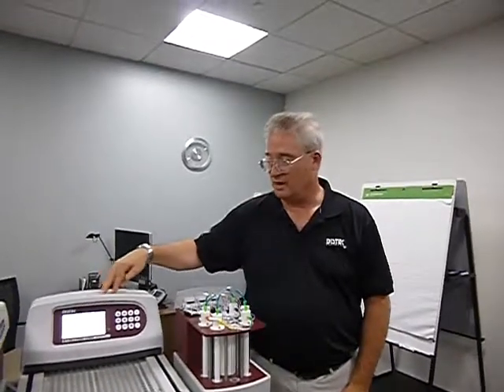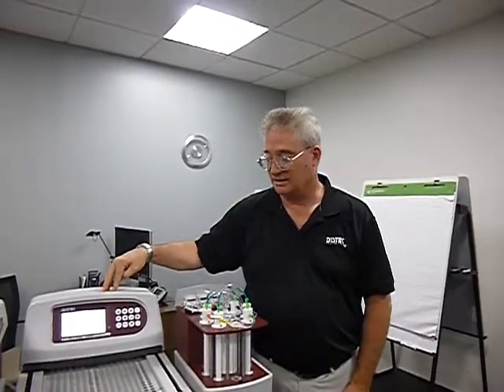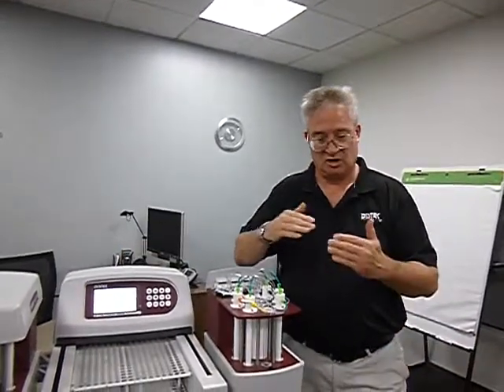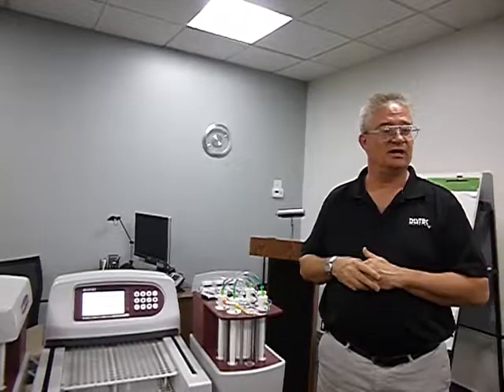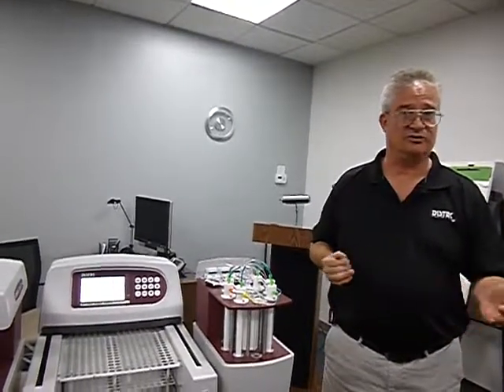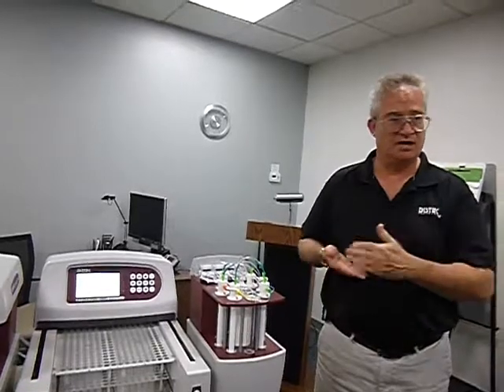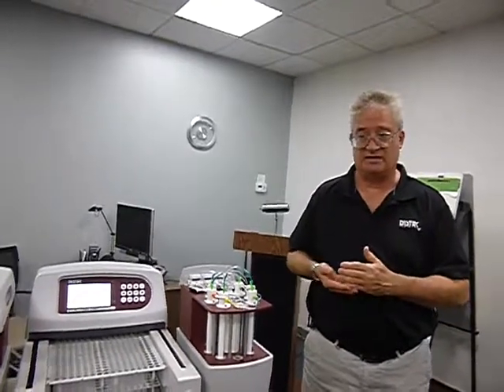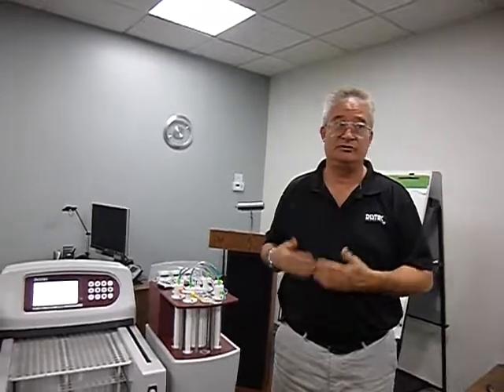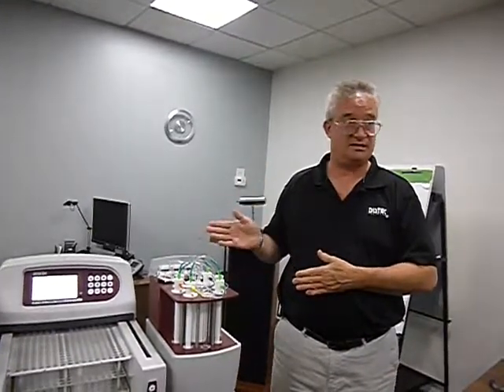Now, where you may run into a time conflict is if you're running them close and you're running it at too slow of a speed. This is something you can tell your customer. Oh, well, I want to run every 10 minutes, I want pulls every 10 minutes or something like that. Or for some reason, I want it every 5 minutes. Well, you want it every 5 minutes, you can't run it at 4 mils a minute. You've got to run it fast.